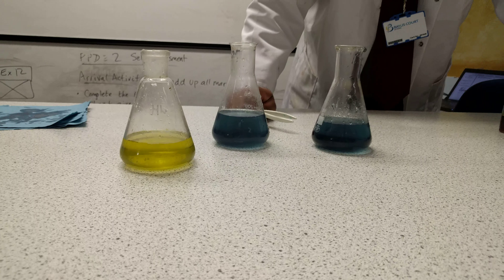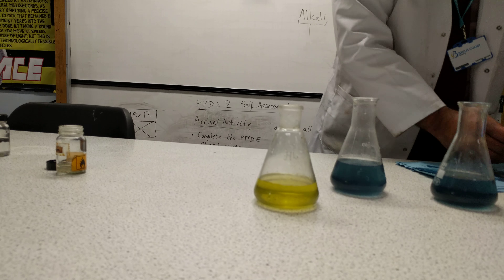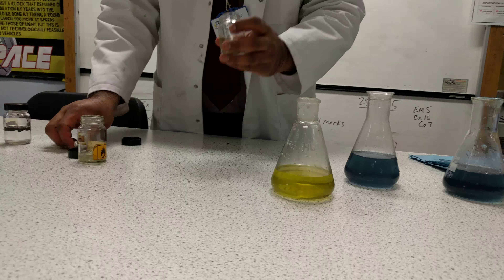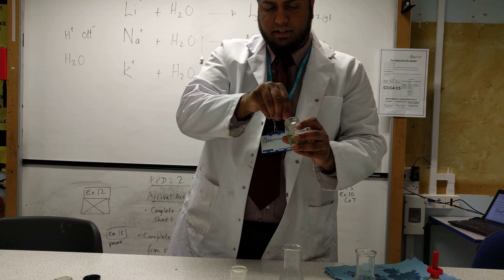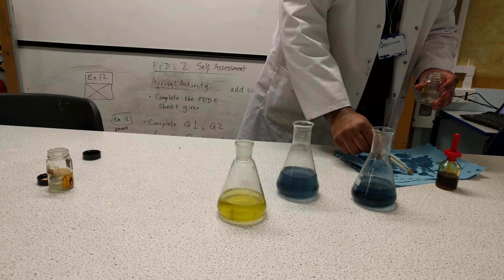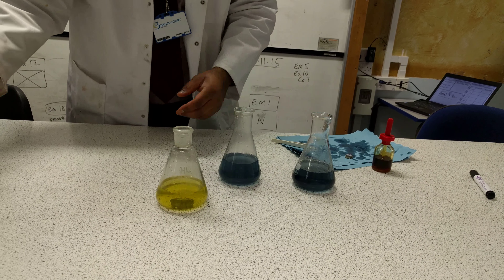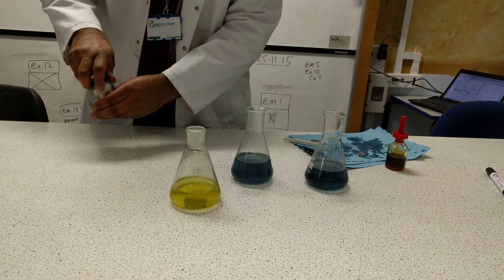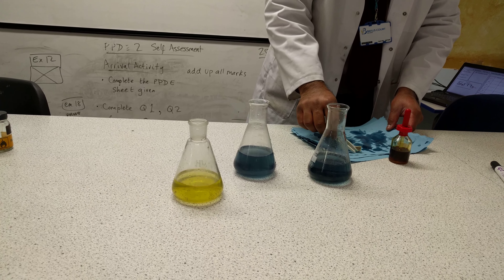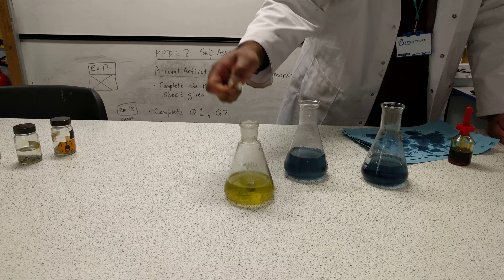Next we're going to look at potassium. I'll take some pieces of potassium. Potassium is further down the group and is rather very reactive. The reason I'm taking a larger piece is because most of it has already oxidized — it's formed an oxide layer. It's not a very fresh piece, but we'll use it. I want you to notice how vigorous the reaction is — it's further down the group and has more atomic shells around it. I'm going to drop it into the water — step back very quickly.